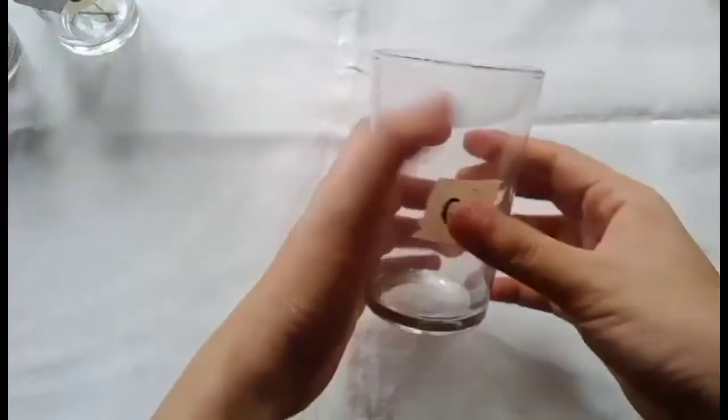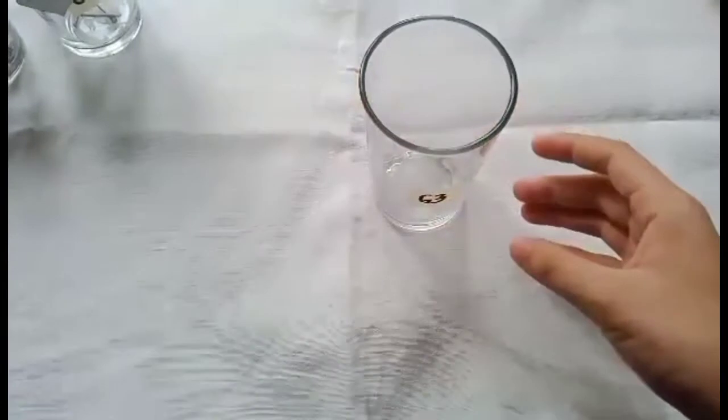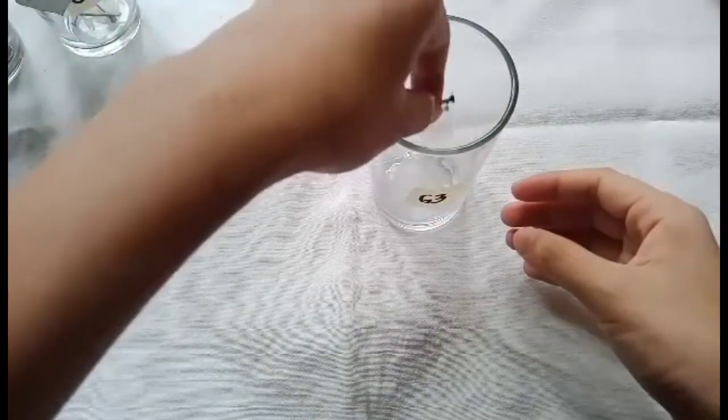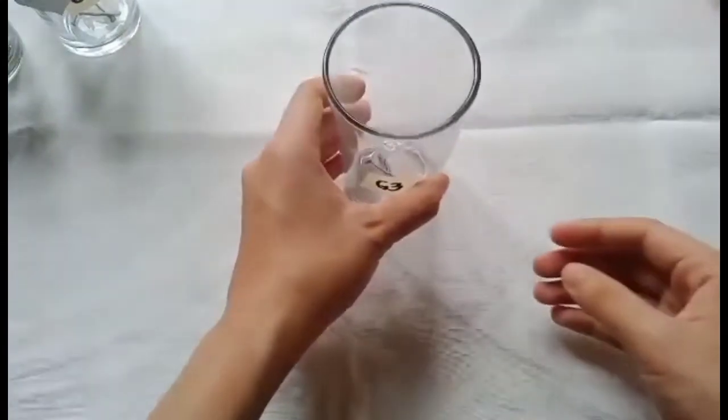Fourth, in the third clean and dry clear glass, do not put any liquid, just the 3 pieces of nails. Do not cover and set aside for observation.